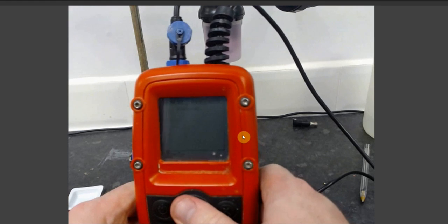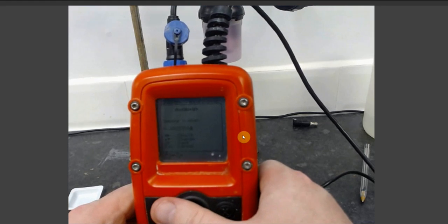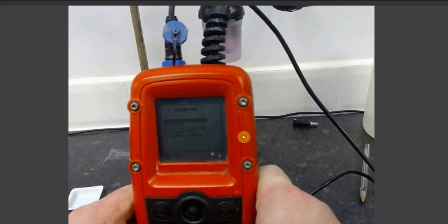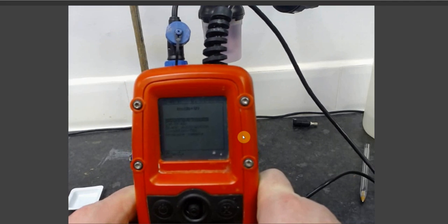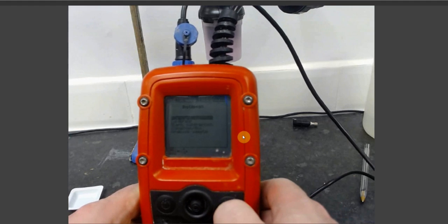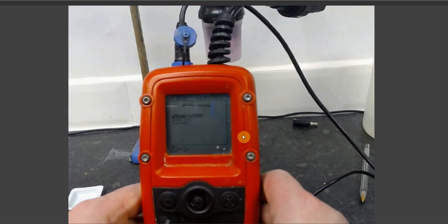If you select yes, it will take you to a screen where you may give your data a file name. If you press select again, it will save your data and take you back to the submenu for total arsenic. If you select no when asked whether you wish to save your data, you will also be taken back to the submenu for arsenic total. From here, you can use the cancel button on your Metalyser handheld unit to navigate back to the main menu.